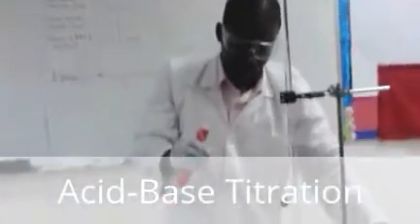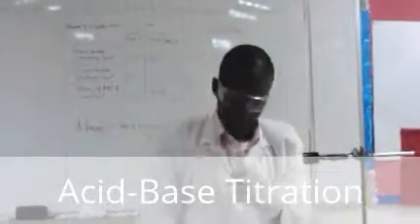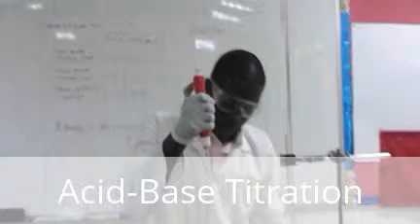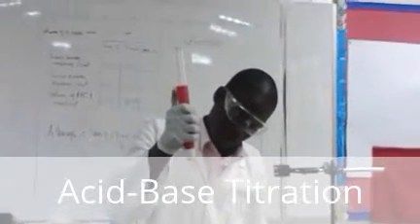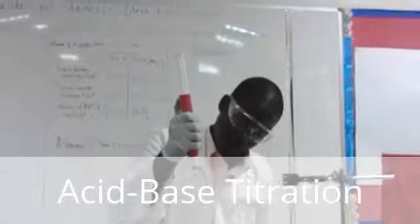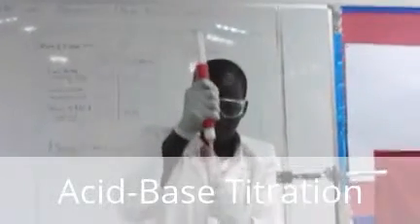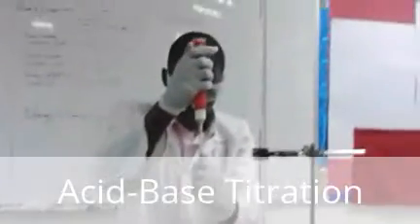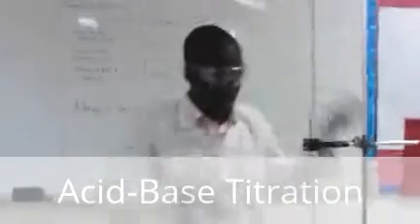Once again, I pipette 25.0. I pipette 25. I pipette 25.0 of the base, which is sodium hydroxide. Remember, sodium hydroxide is a strong base. Into the conical flask.